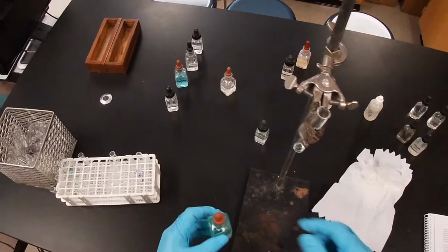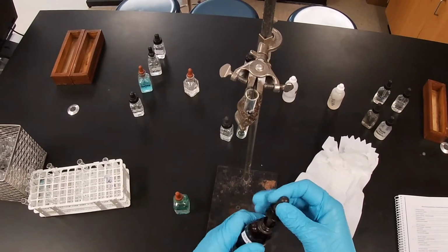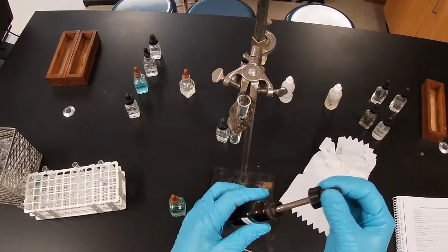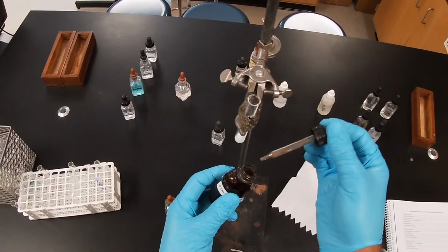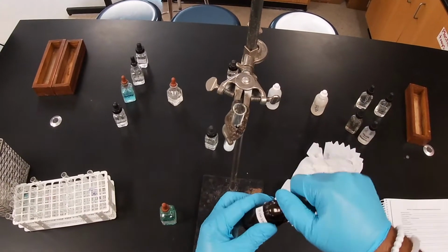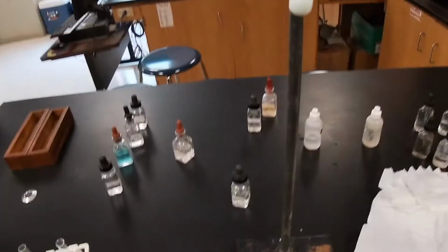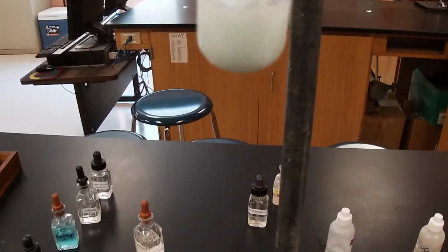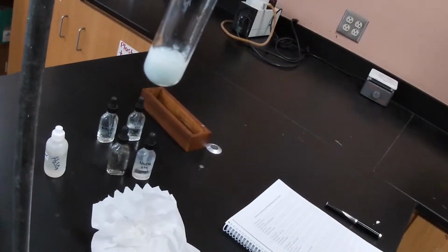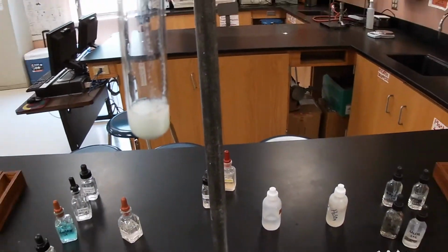Okay. Let's go ahead and add our silver nitrate. Now you've got to be careful with the silver nitrate. The silver nitrate is a staining solution, and so sometimes if it gets on your skin, you might get a temporary tattoo. As you can see, as soon as I dropped it in, we get a nice little precipitate. And there is our precipitate from our 2 solutions. It looks somewhat greenish. I don't know if you can tell, but definitely a thick blob of our precipitate.